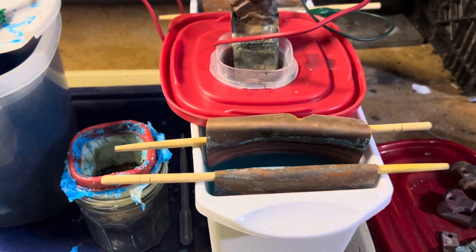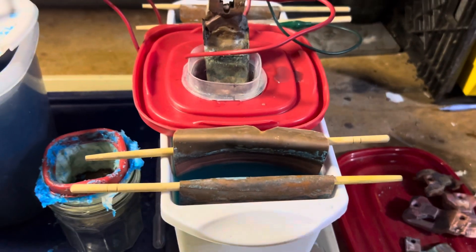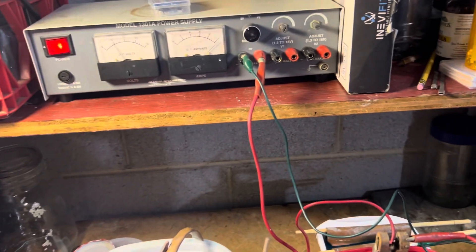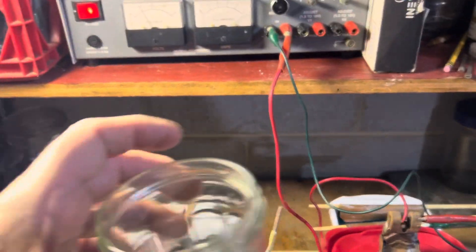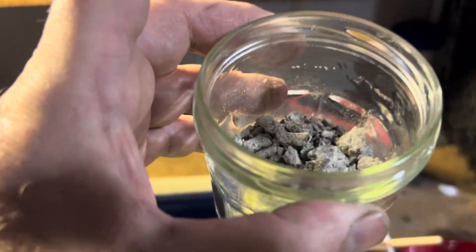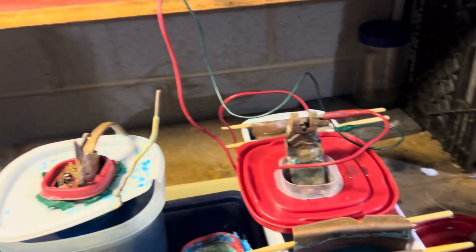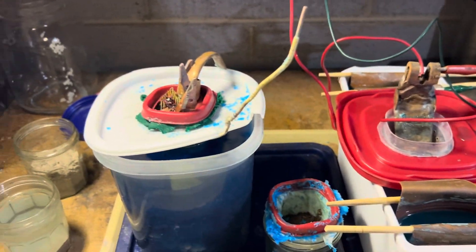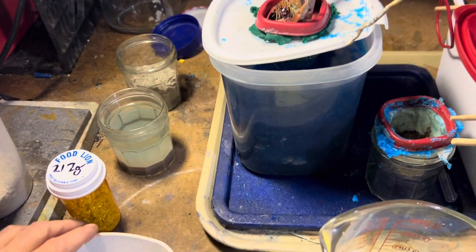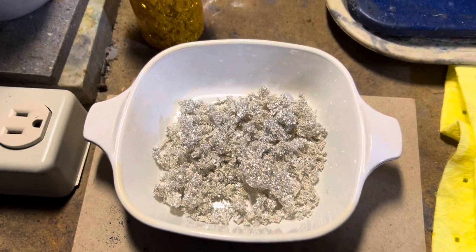To recap, we're going to recover the silver as slimes. It's going to be dirty. You'll clean it up — you can use hydrochloric acid to clean it up with several washings. This is what it looks like after it's cleaned up, and this is what it looks like when it's really cleaned up. And this is silver crystals.